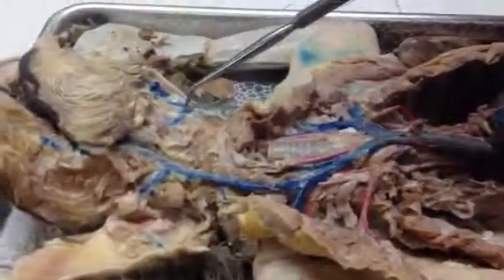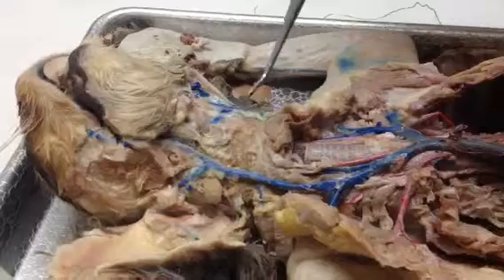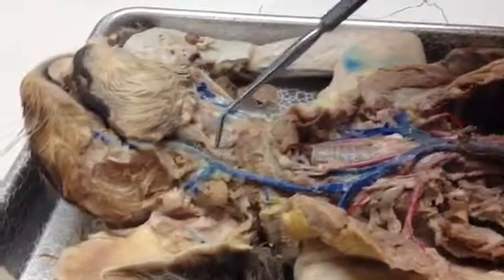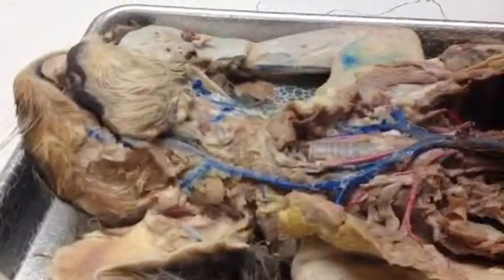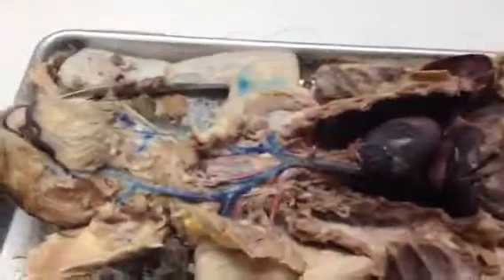All right, so if we follow the external jugulars up, we're going to see the transverse jugular that's going to connect both the right and the left external jugulars. And then right near the transverse, you'll see a branch from the external jugular, and that's going to make your anterior facial vein and your posterior facial vein. And we see that here on the right side. We can't see that on the left side. And that's it. That's a wrap. Good job.